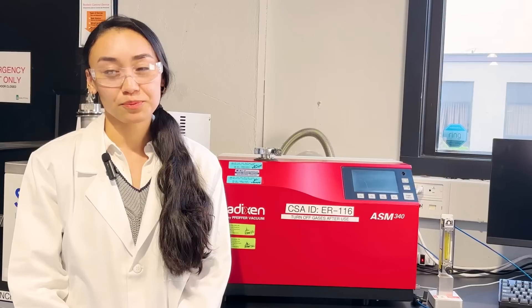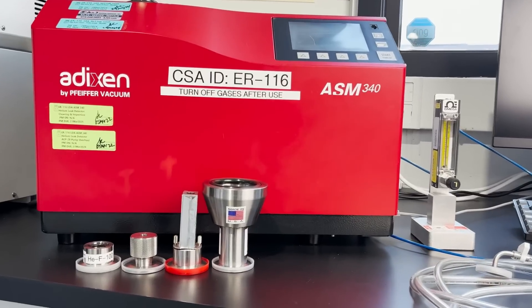As outlined in Procedure A of the ASTM, helium leak detection in sniffer mode can also be used for a wide range of sample types and is typically applied in a more investigative manner for determining the location of leaks. In this mode, a sniffer probe is pneumatically connected to the top part of the instrument, as opposed to a fixture in vacuum mode.